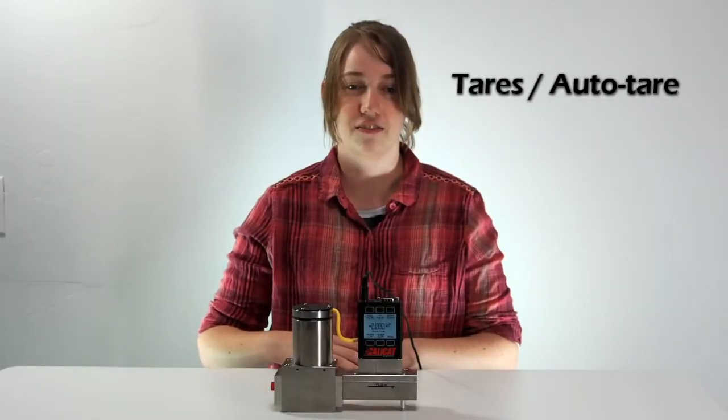Hi, my name is Marina Palaci and I'm an applications engineer at Alicat Scientific. Today I'm going to show you how to tare your device and how to enable auto tare. Let's get started.